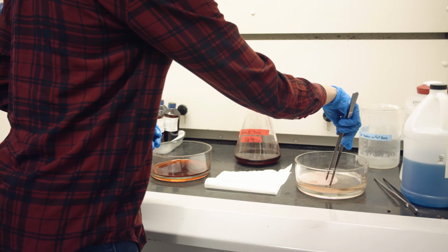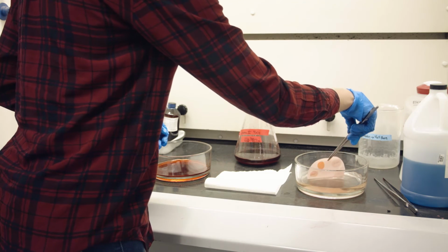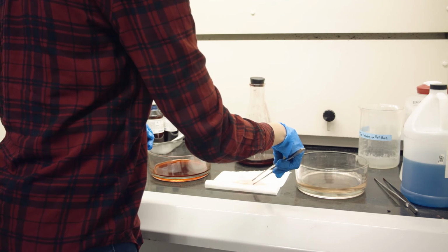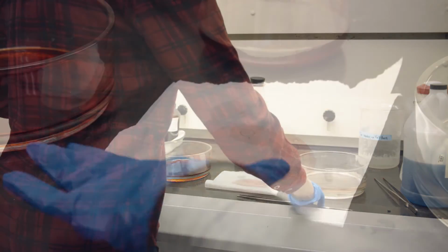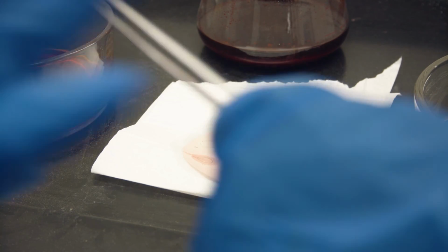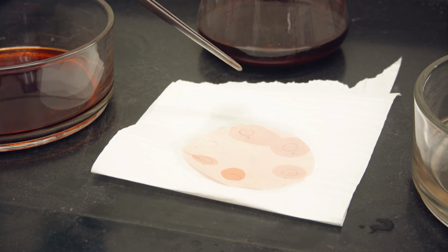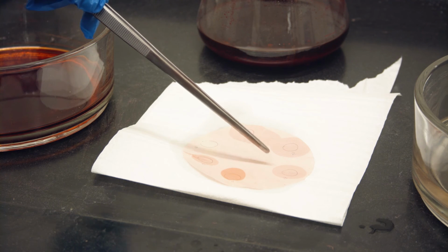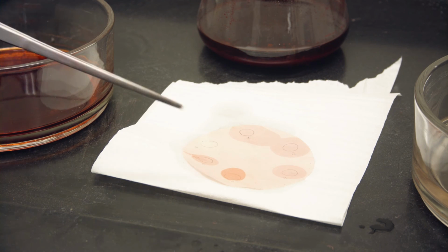Once this is completed, carefully transfer your filter paper onto a set of clean paper towels and then examine your results. A brilliant orange color indicates a positive result, while anything else would be a negative result. Be sure to compare your unknown sample results with the positive and negative controls and then proceed to data analysis.